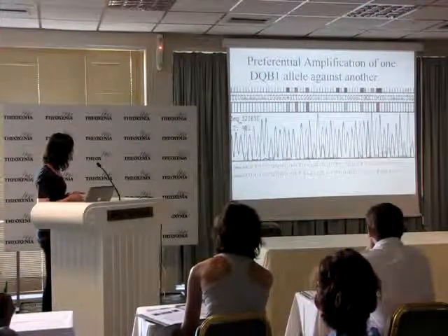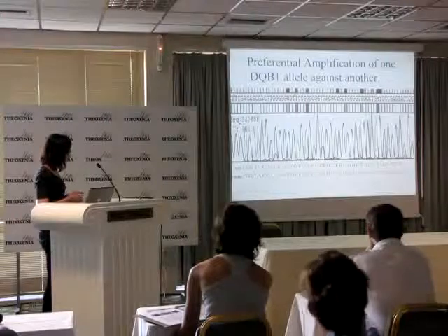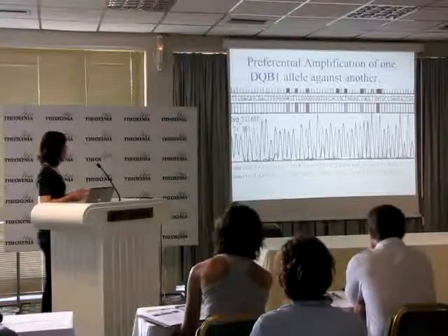So this is an example as well. You've got the big C peak and the small a, and the software is picking it up as a C when it is clearly an M. So this is a problem.